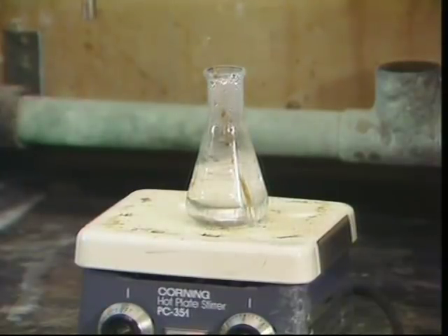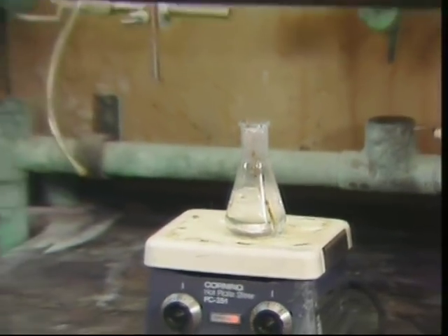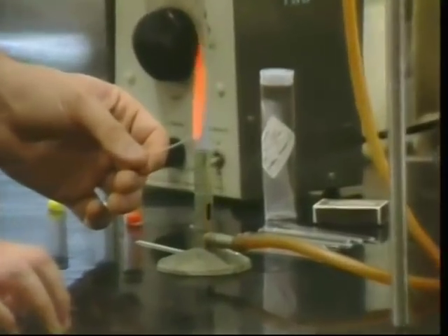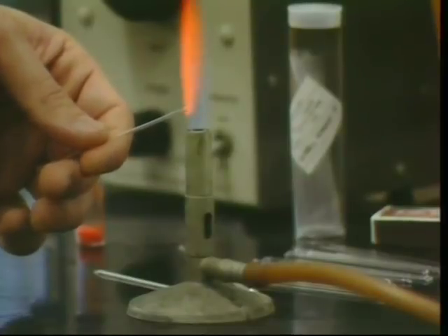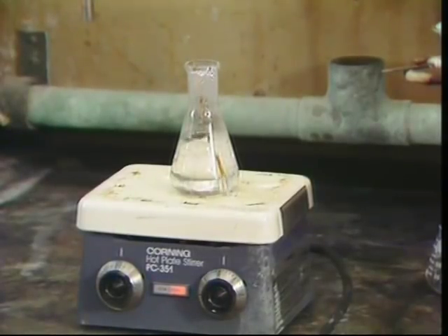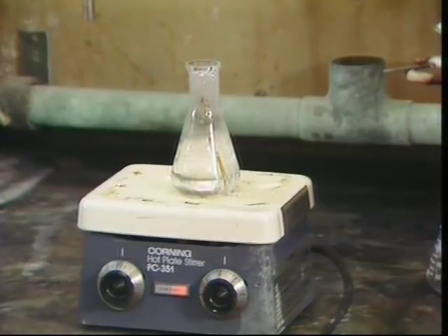Anytime that you're working with chemicals that are toxic, volatile, have a strong odor, or are flammable, you should do your work in a fume hood. Some chemical vapors are heavier than air, and if you are not working in a fume hood, these vapors could hug a lab bench and travel quite a distance, possibly down the bench to someone who is using a burner. If the vapors are flammable, the resulting explosion will quite literally knock you off your feet. So use the hood if the vapors of the chemicals that you're working with are hazardous.